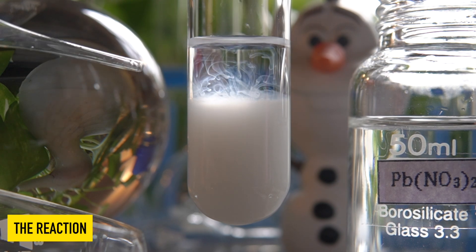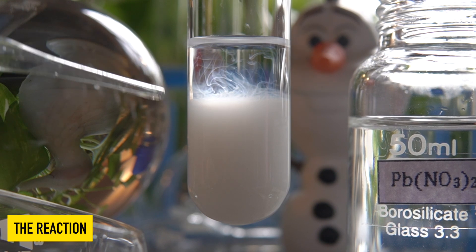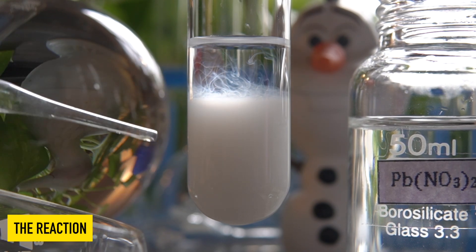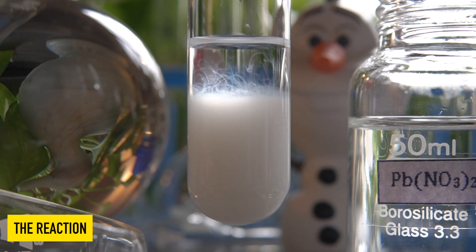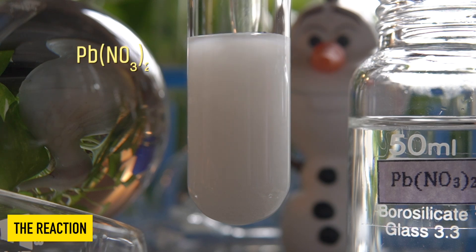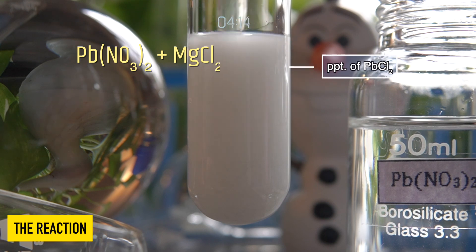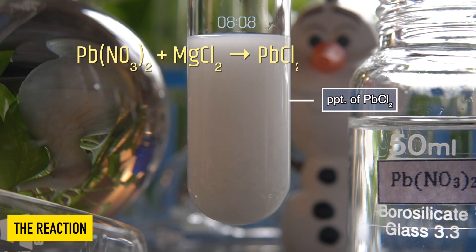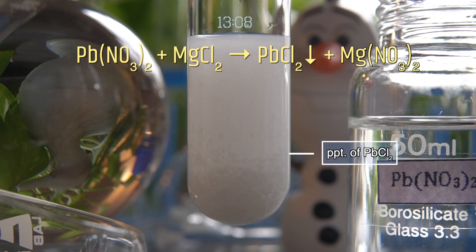The white insoluble precipitate that has been formed and settled at the bottom of the test tube is nothing but lead chloride. In this reaction, lead nitrate reacts with magnesium chloride to produce an insoluble white precipitate of lead chloride, along with magnesium nitrate.